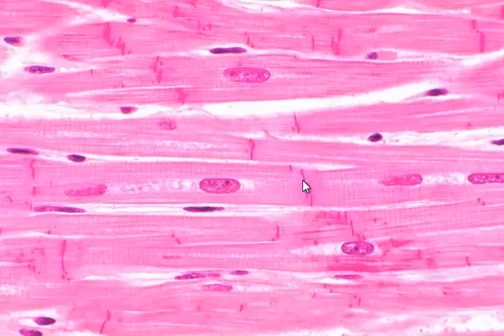And so these intercalated discs are really important because they help the cardiac muscle cells communicate with one another, help with that electrical signal that's going to allow the heart to have the rhythm that it has and do its job hopefully correctly. Something else you'll notice on cardiac tissue that separates it from everything else except for skeletal muscle are these grooves that you can see going up and down too, a little more faint than the intercalated discs, but they are certainly there.